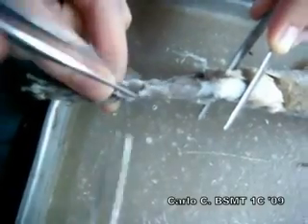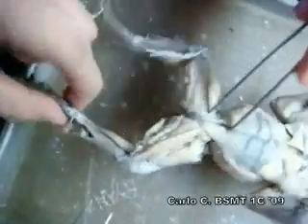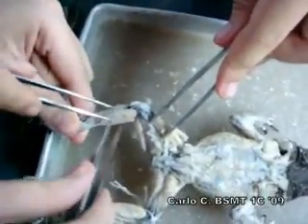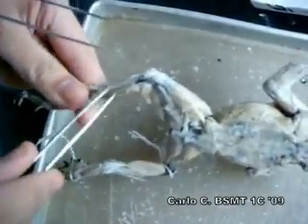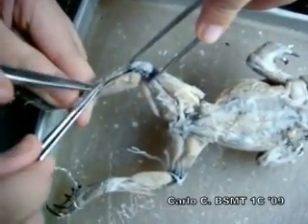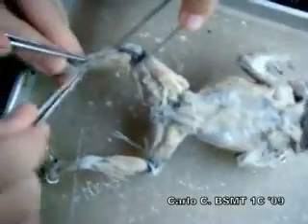Tibialis anticus brevis. And then the peroneus — if this is the gastrocnemius, the peroneus is just adjacent to it.